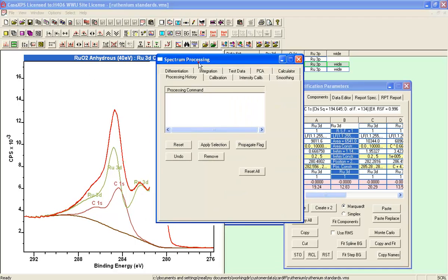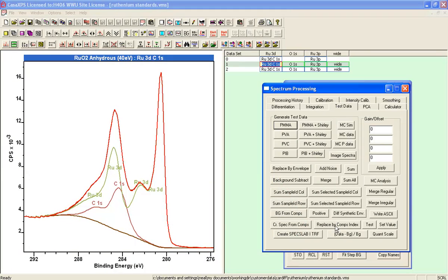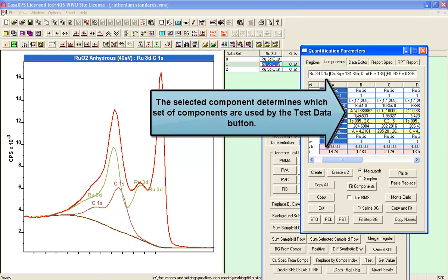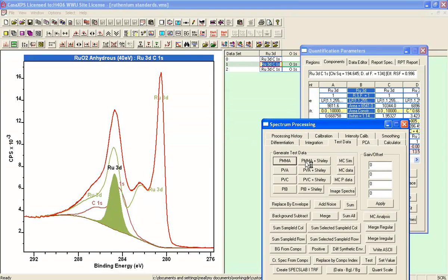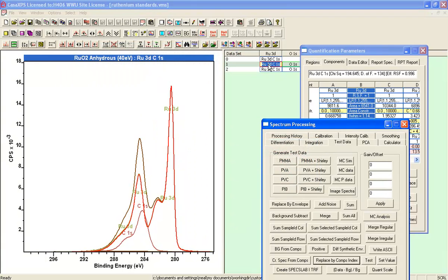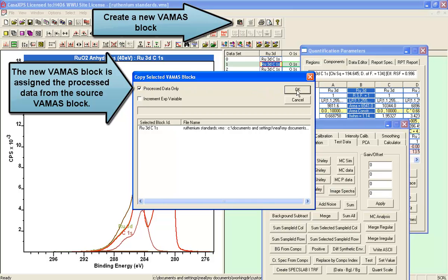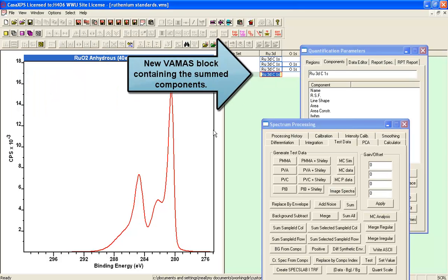So to extract the line shape, what we're going to use now is an option on the Test Data tab that also functions on the basis of these component indices. So it says replace by component index. So the first thing I need to do is indicate which component index. So the component that's selected needs to be 1 with the component index 1, because that would be the ruthenium 3D. And when I press this button here, the process data is set to be equal to the sum of all those components that were assigned the component index of 1, that is the ruthenium 3D. And if I copy that and copy the process data only, I get a VAMAS block that contains the ruthenium 3D doublet from the 4+ state.